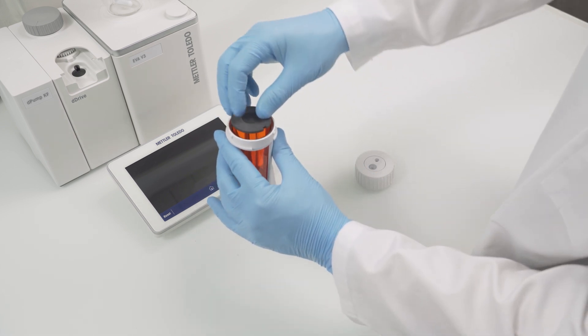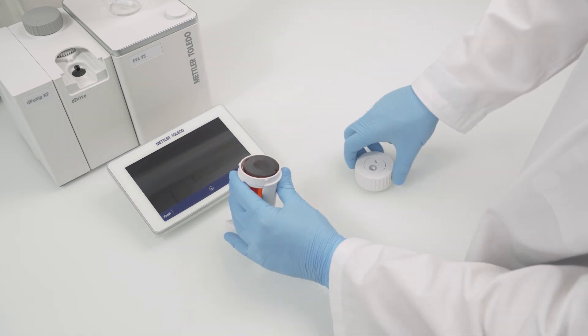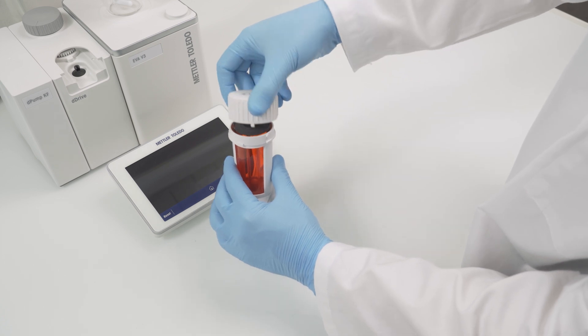Align the cylinder adapter with the two encoder pins. Then close the burette by pushing and rotating the valve head onto the housing.